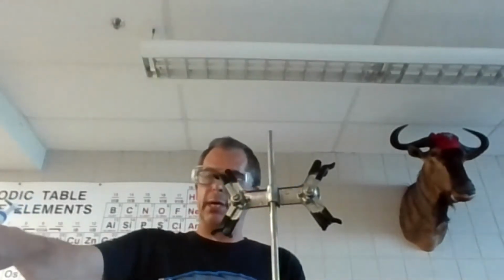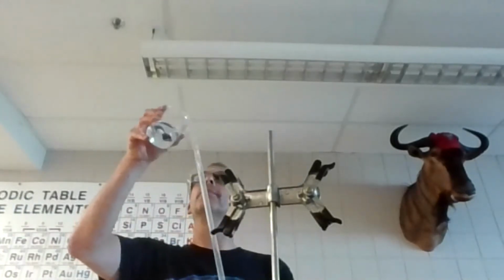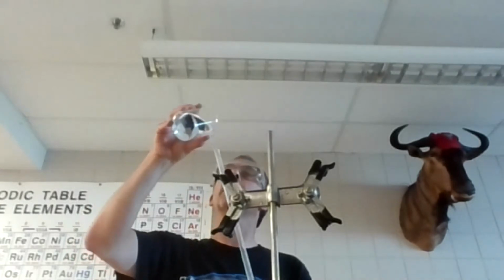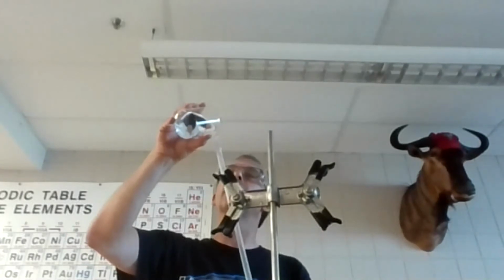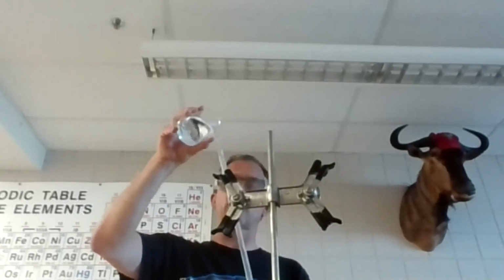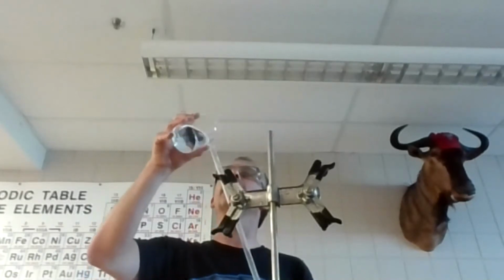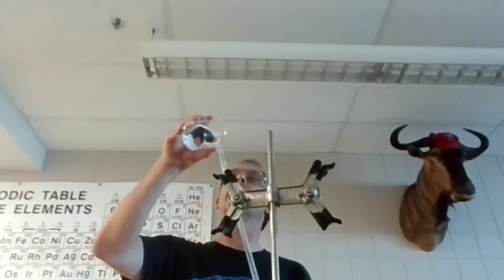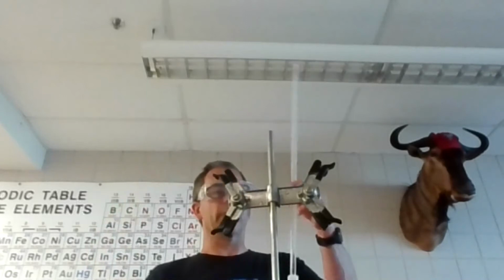I'm going to drop the base in here. Okay, and I probably should use a funnel, but I'm not going to grab that. I would probably recommend it. And I might fill it like half full. I wouldn't fill it as full if I were worried about how much I have, but now I got 100 milliliters. And I'm thinking that it's a 1-to-1 ratio. I think I got 34 milliliters of acid. So I should have plenty to play around with.